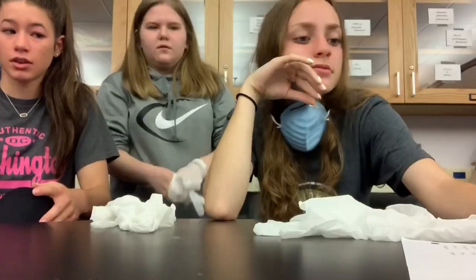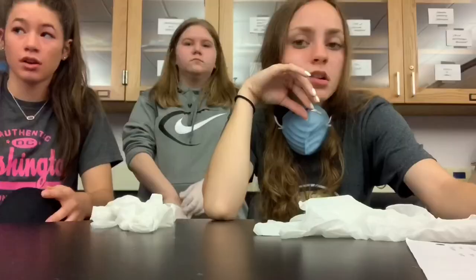Let's read the notes. There's the abdomen. Okay, I've got some color back in my face. No, no, no, no, no, no. I don't want to hear it. No — I'm just looking at me right now. That's okay, do whatever you want with that poor frog. I'll get Ellen — can you get my phone over there? I'll get it for you.